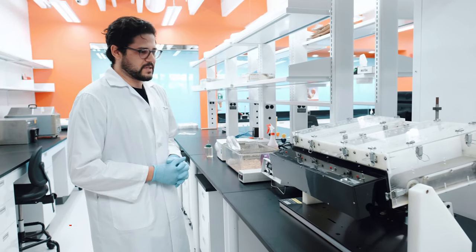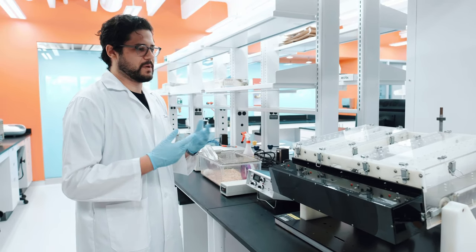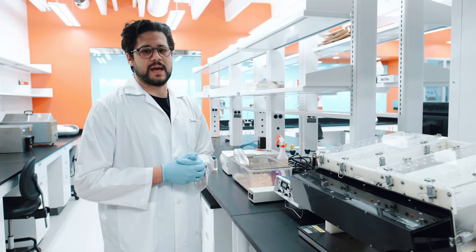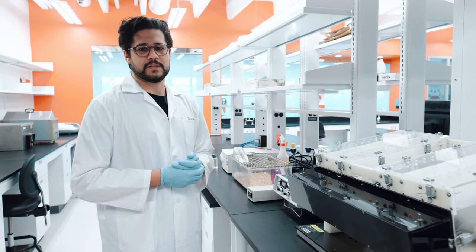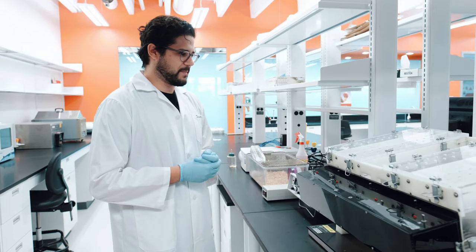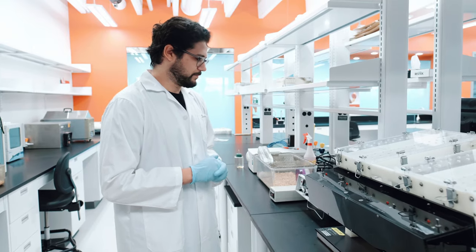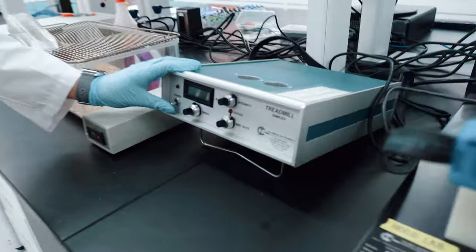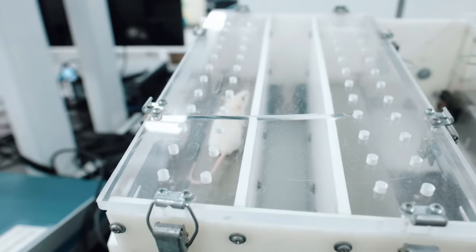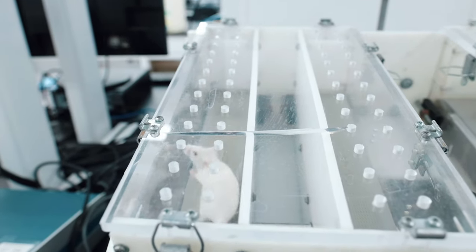Here we have the mouse treadmill, which allows us to control the exercise stimulus. We can use it for an acute bout of exercise — one exhaustive bout — and then take the tissue and look at different measures of gene expression and metabolites that change with that acute amount of exercise. Or we can use it over a long period of time as a training study. The benefit of the treadmill is that we can control the stimulus across animals and increase the intensity as they develop throughout the training stimulus.